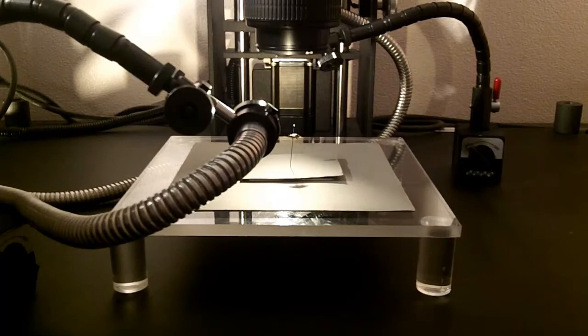And now let's look at how we can use these fiber optic cables with diffusers added. So here I'm just going to put a diffuser around the specimen. We're still getting that raking light over the specimen, but we're having the light be more diffuse and those shiny spots that you saw earlier on the sides less noticeable.